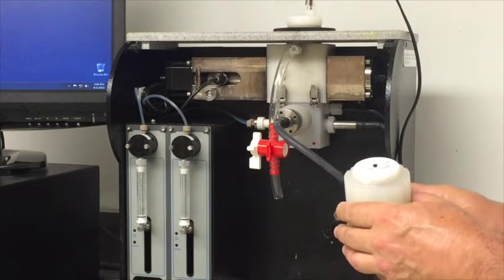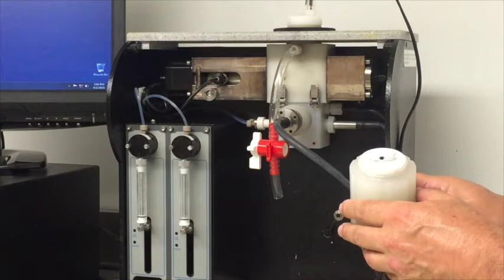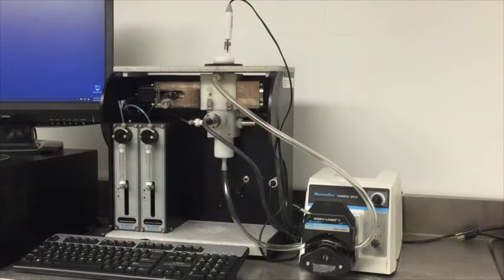For more viscous samples, we can use a peristaltic pump. Mixing is required only for samples that settle or for titrations. Otherwise, we can work with stable, stationary samples, which allows us to minimize sample volume and simplifies cleaning. It is convenient in such cases to work with different sensors individually.